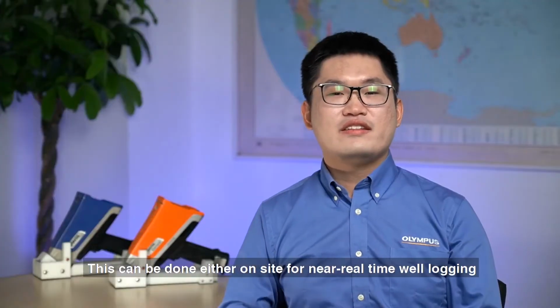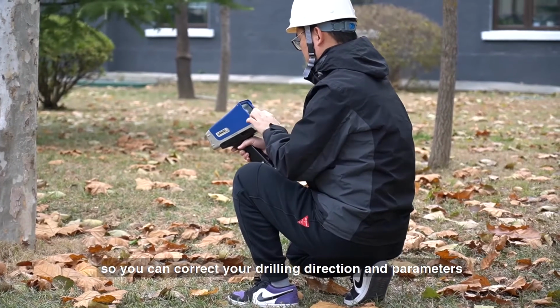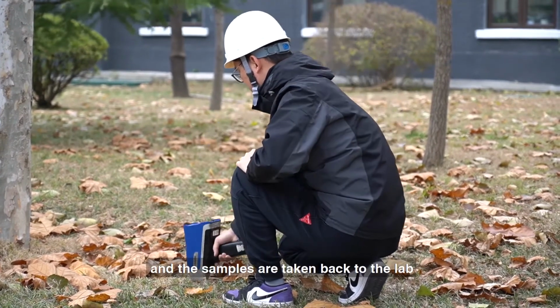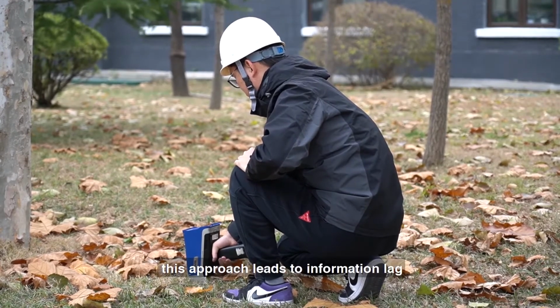This can be done either on-site for near real-time well logging, so you can correct your drilling direction and parameters, or after the well is drilled and the samples are taken back to the lab. Obviously, this approach leads to information lag.